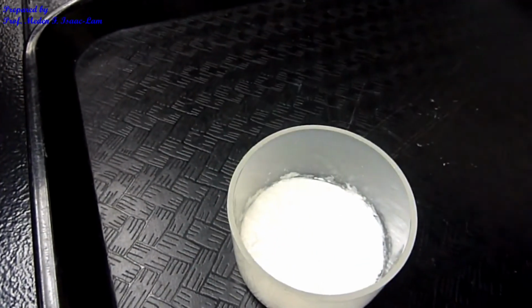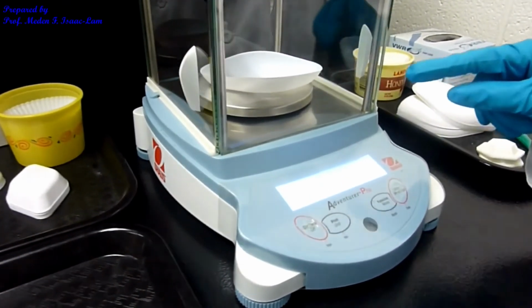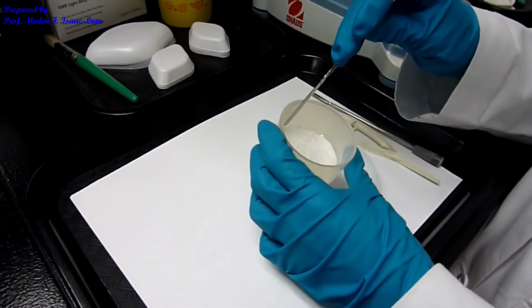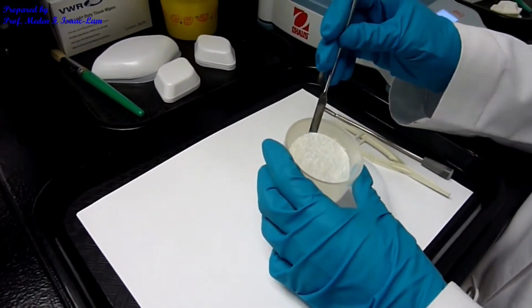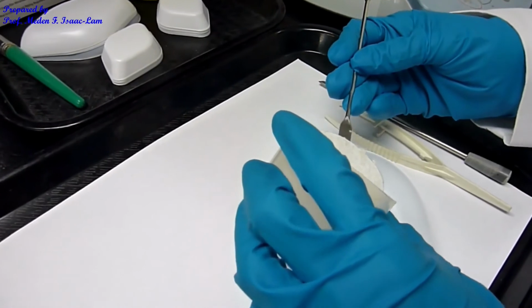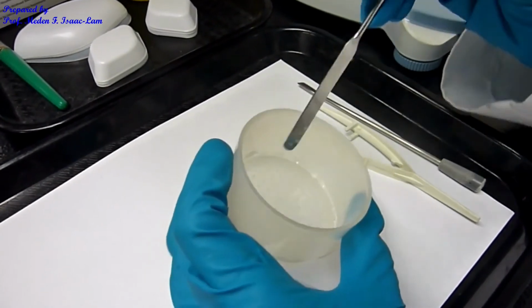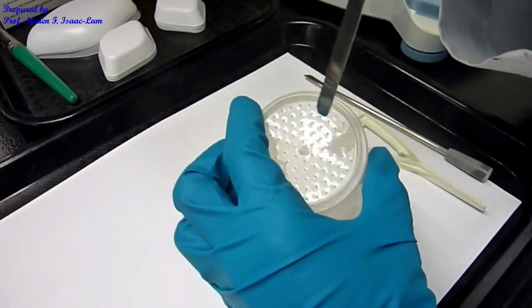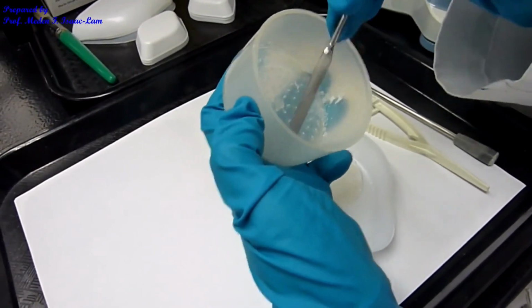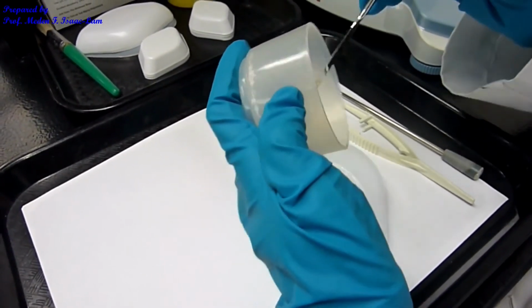Okay, so in the balance right now, I zeroed the weighing boat. So the weighing boat is inside the balance, and it's 0 right now. I'm now taking the sample out so the filter paper lifts easily, and now I'm going to transfer it into the boat, and that basically is our sample. There are some particles inside, so I'm going to scrape them out so that I can get the whole weight.